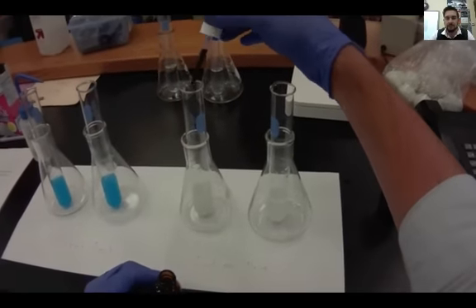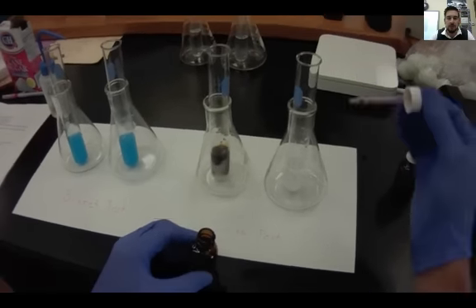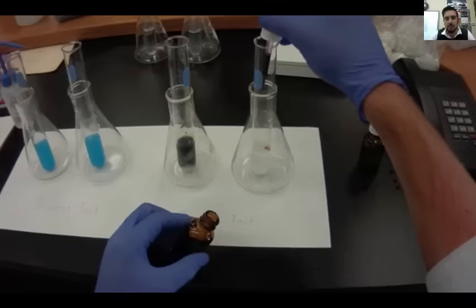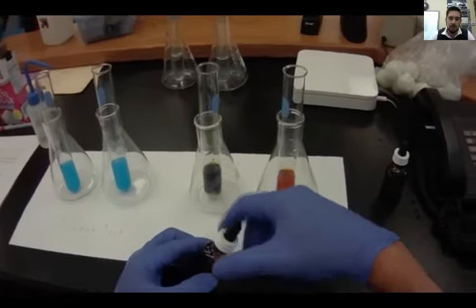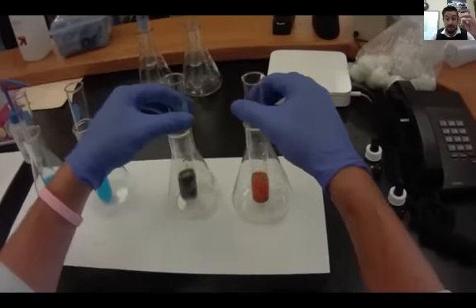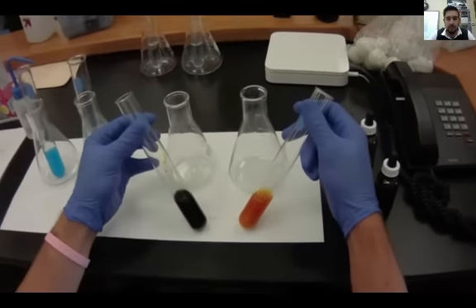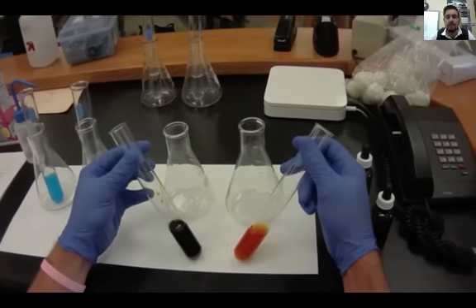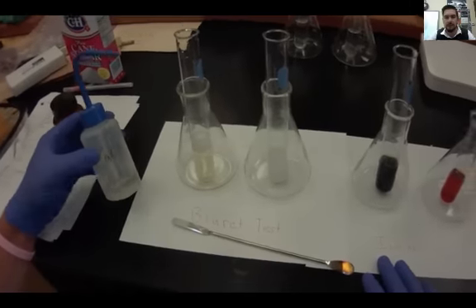The left one turns a dark cloudy black and the right one, well it remains kind of the iodine brown color. The one on the left is a positive for polysaccharides because that's what the iodine test looks for. So I would say the one on the left is positive, meaning it has polysaccharides in it. The one on the right is a negative.